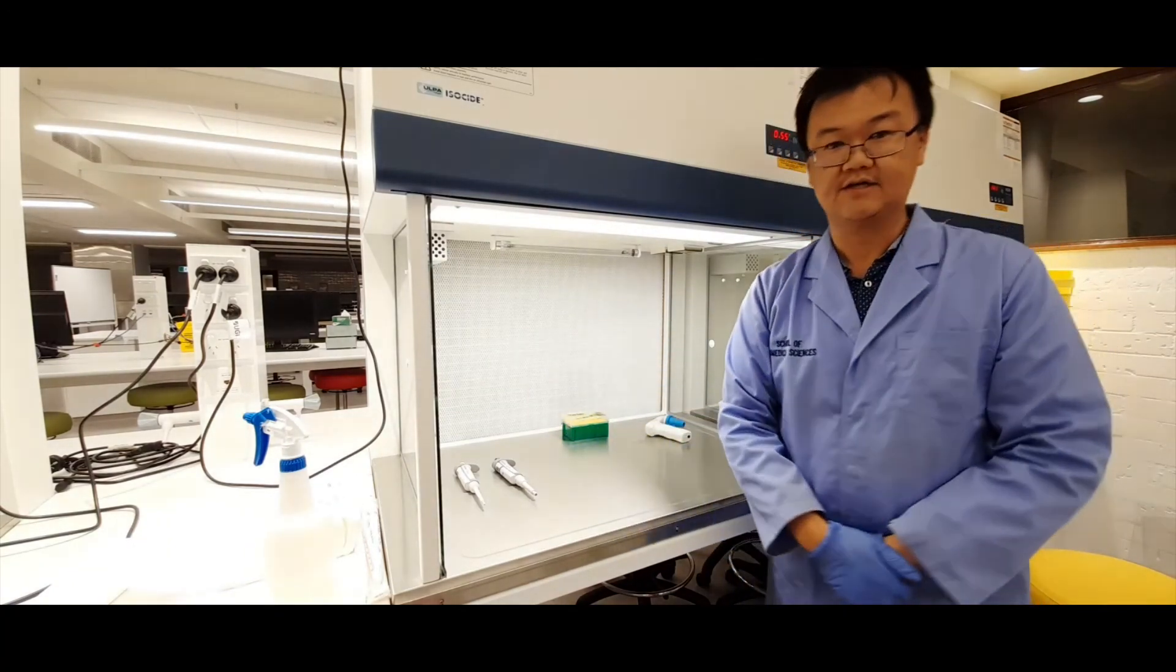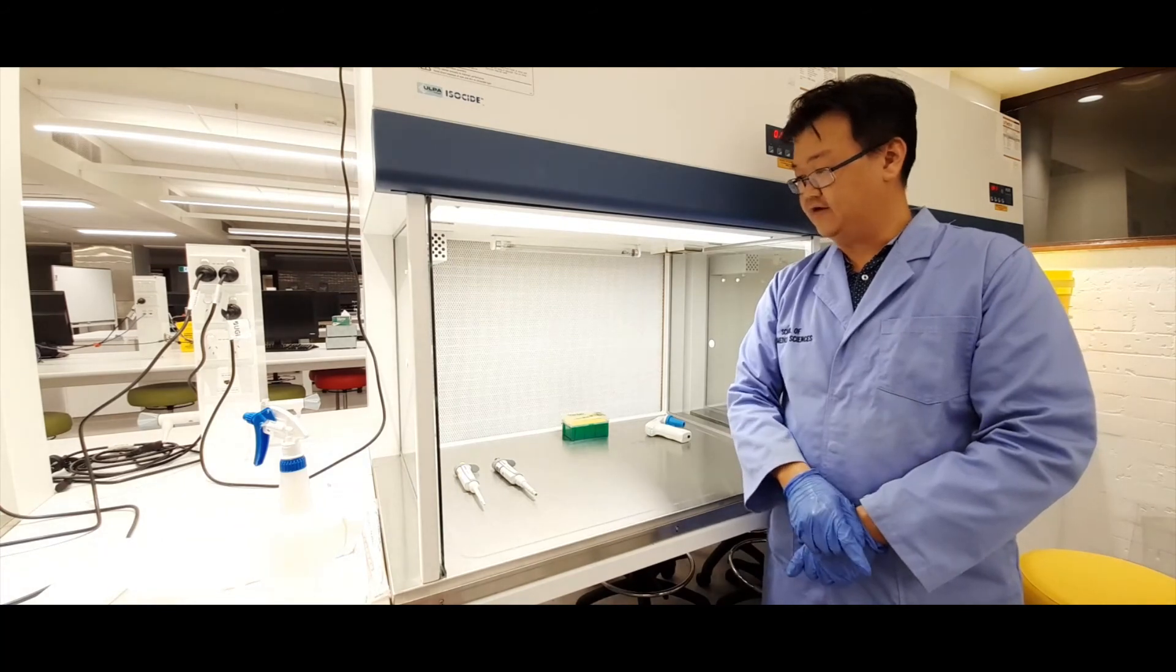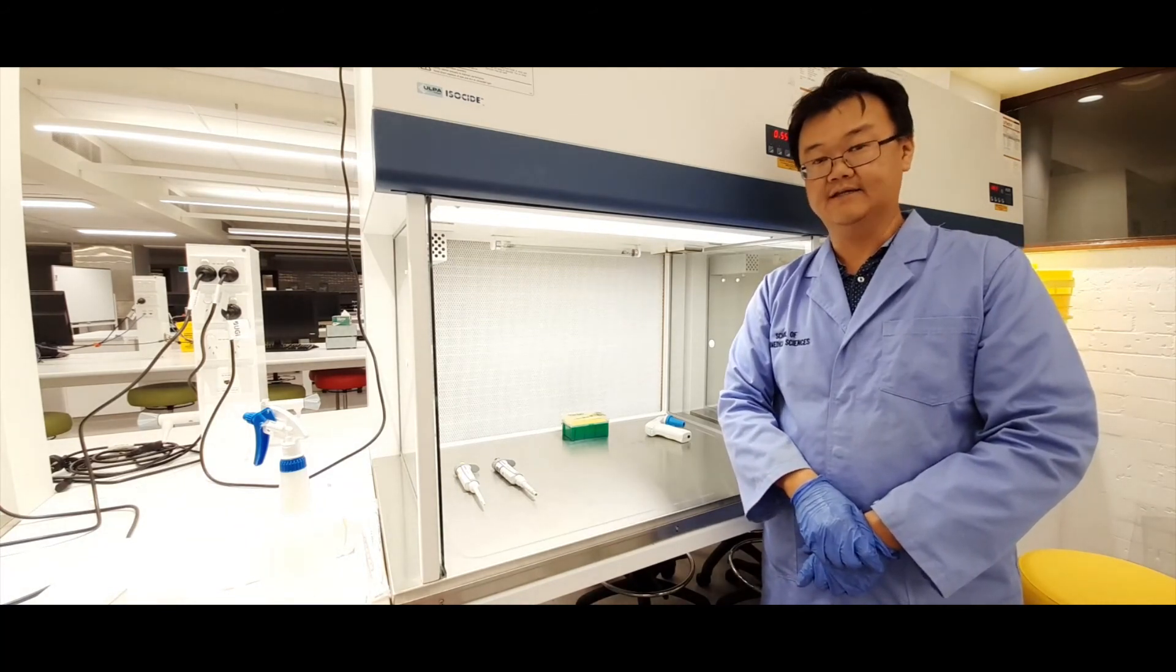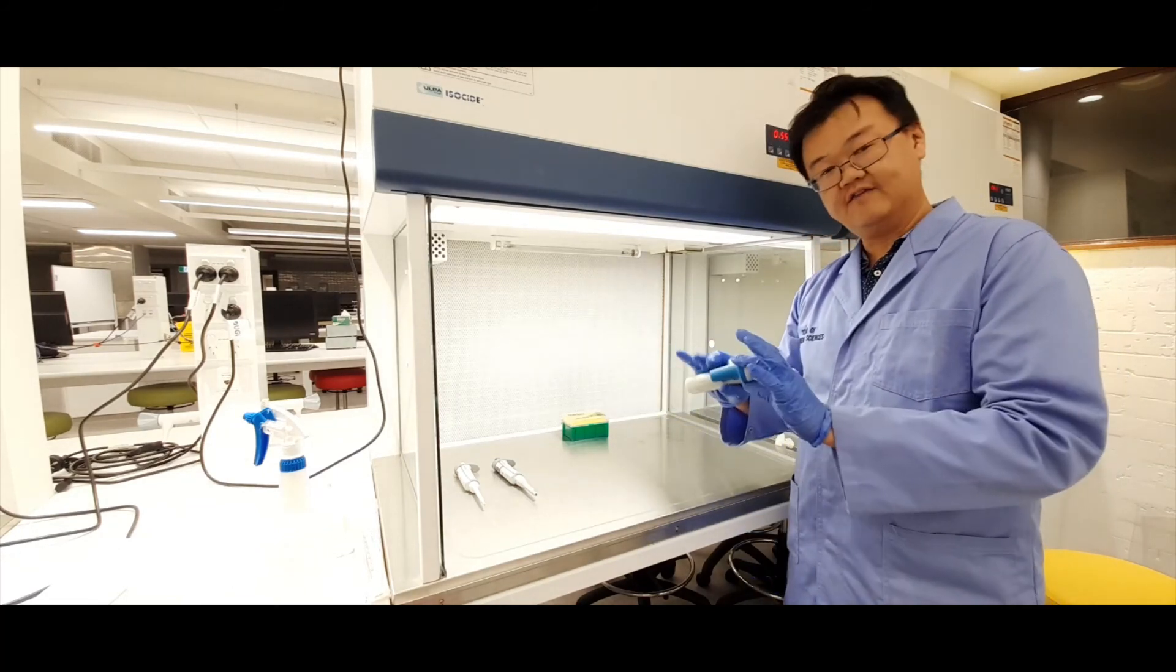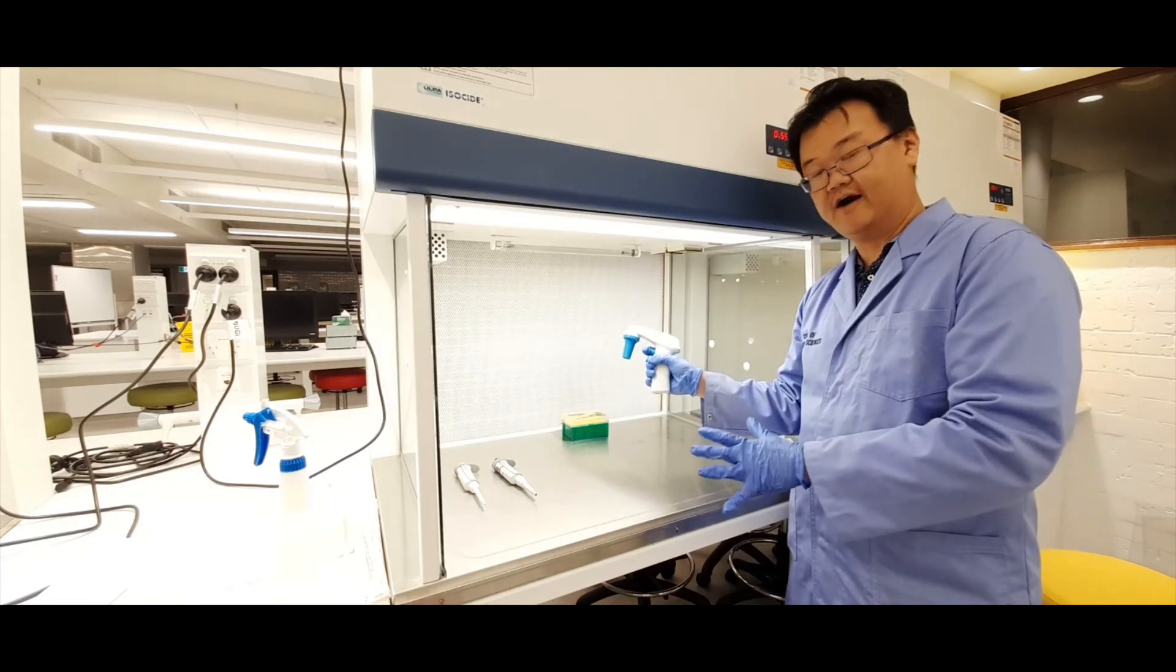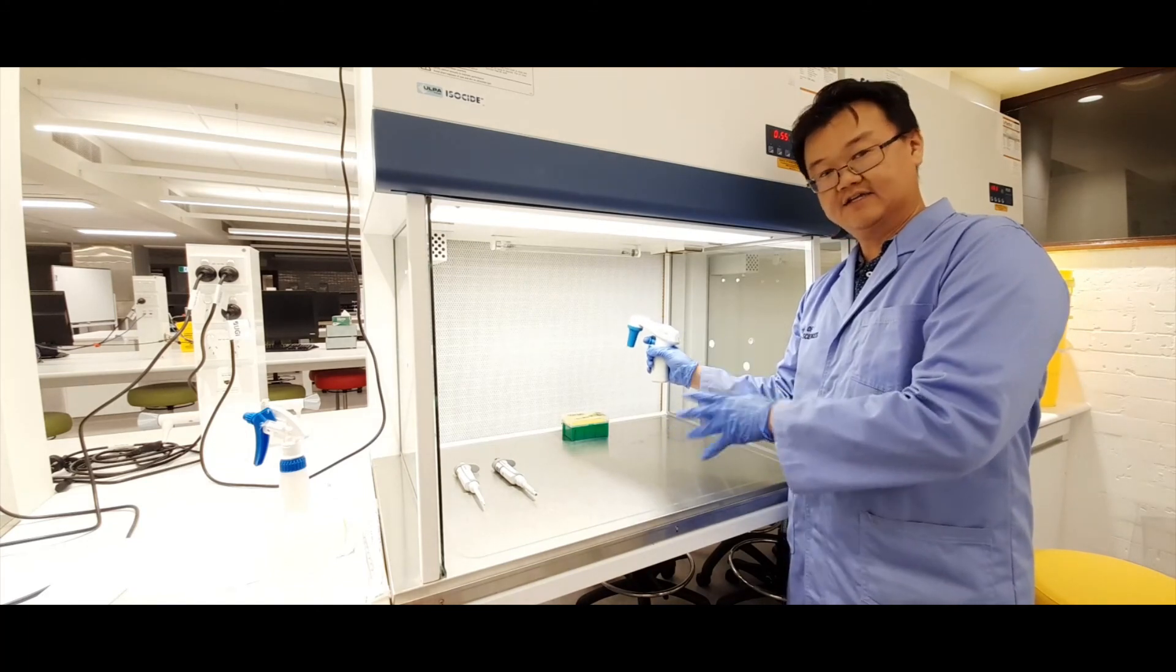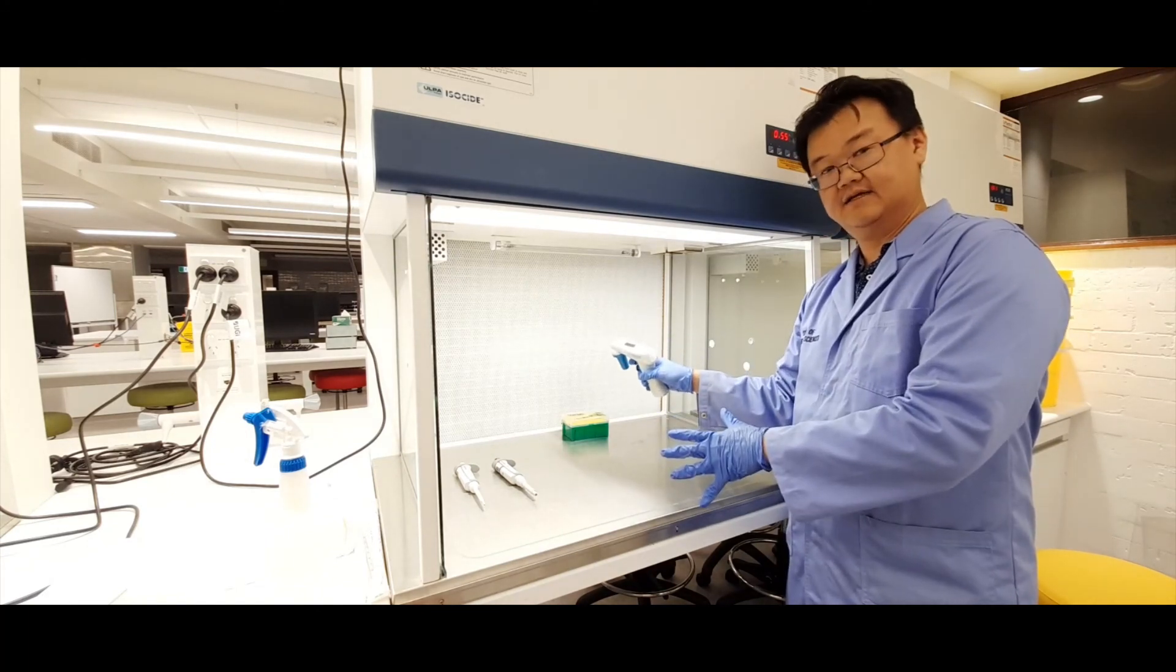Okay, so we'll end the video there. And in the next couple of videos, I'll show you how to use one of these pipette guns and how to transfer media and other solutions inside the cell culture hood.